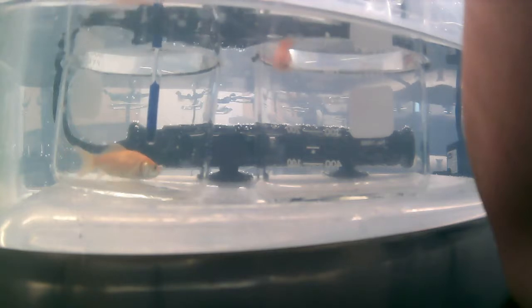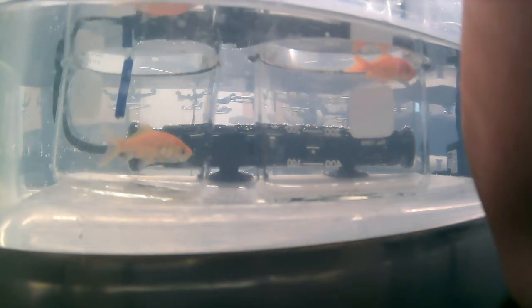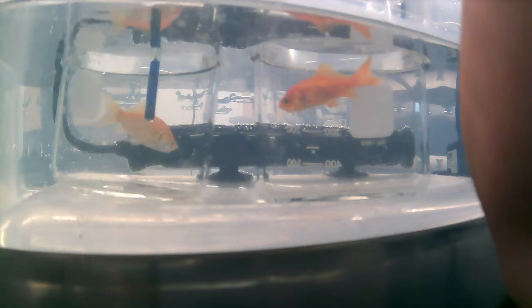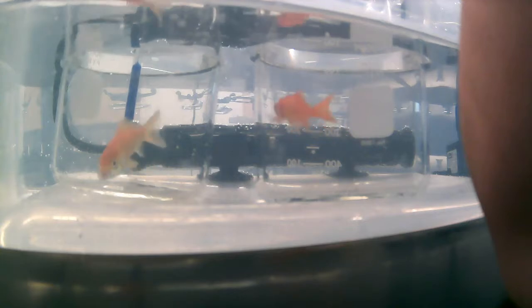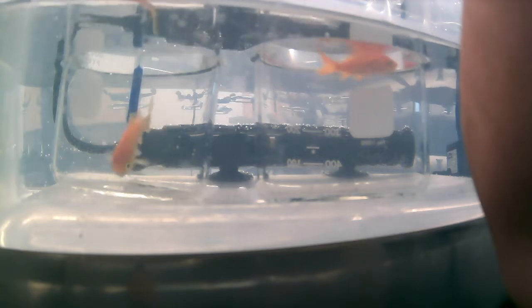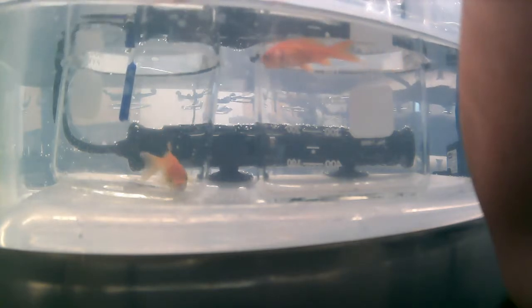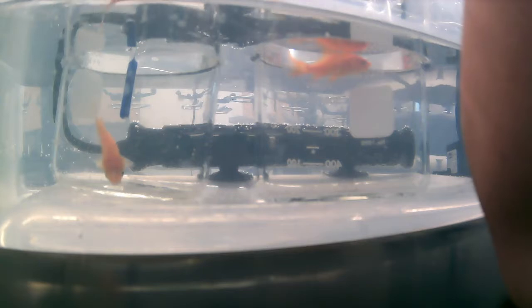Okay, so you can see that the fish in the first beaker is now coming up on loss of equilibrium. He's lost side-to-side orientation, and movements have become much more urgent. Oftentimes you'll see high levels of activity, and then they'll slow way down, maybe roll over with initial loss of equilibrium. Shortly after that stage, they should show complete loss of equilibrium, and may also show muscle spasms.